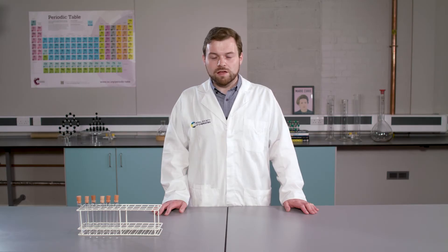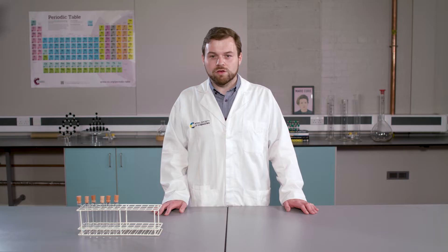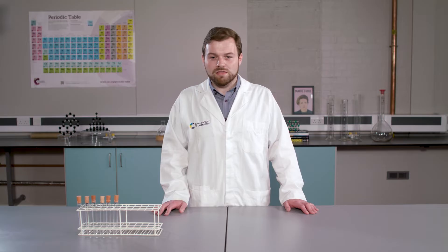Some tests will give a single positive result, so it makes sense to do those tests first. Other tests will give multiple positive results, so we will save those till later. It also makes sense to do the test with the least hazardous or harmful reagents first, and save the test with the most hazardous or harmful reagents until later, when there are fewer samples. I am going to begin by doing a test where I expect to get one positive result.